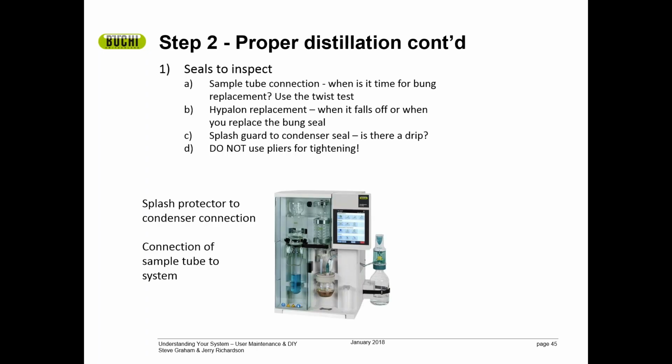So, what if I discover that I have leaks in the system? Where should I look for leaks? Okay, the sample tube connection, which is the lower circle on this image, should be replaced on a routine basis. If you have an annual PM service contract, we replace that, but it's also a very simple thing to find out, should I replace that? Okay, let's go to the next slide here.